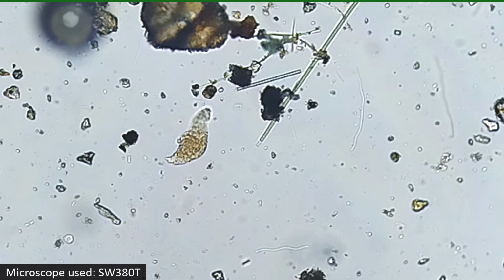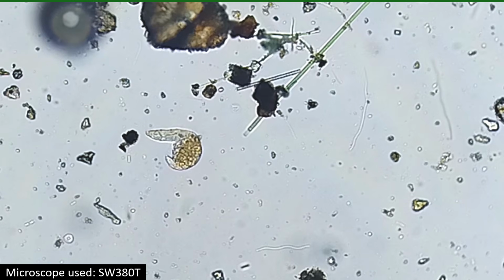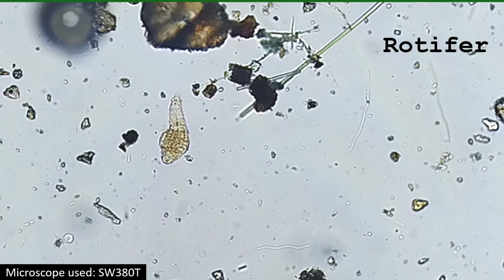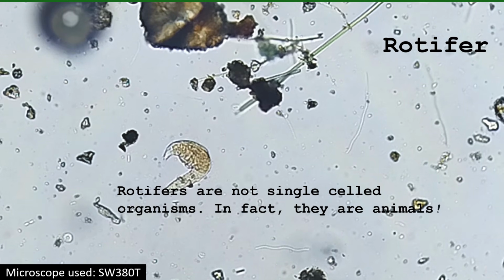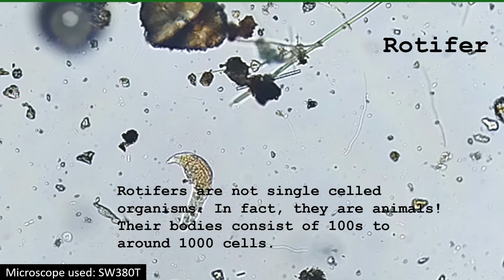This is one of the most common microorganisms in my moss samples. It is known as a rotifer. Rotifers are not single-celled organisms. In fact, they are animals. Their bodies consist of hundreds to around 1,000 cells.